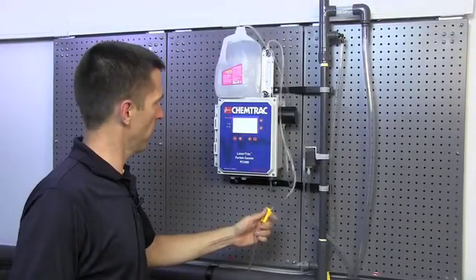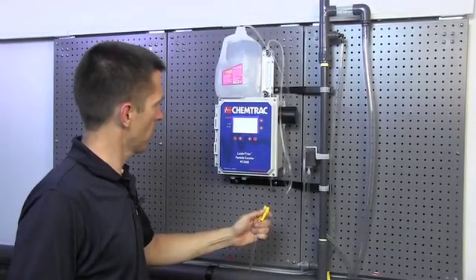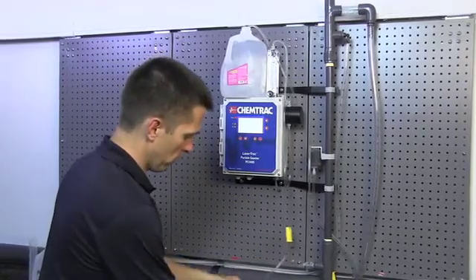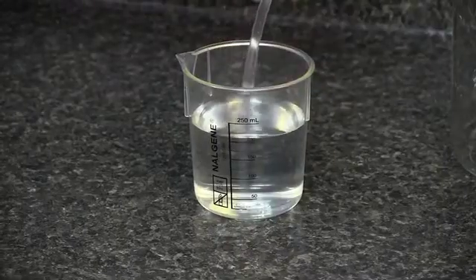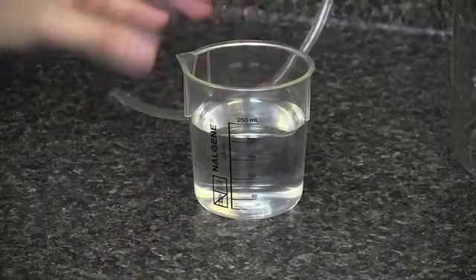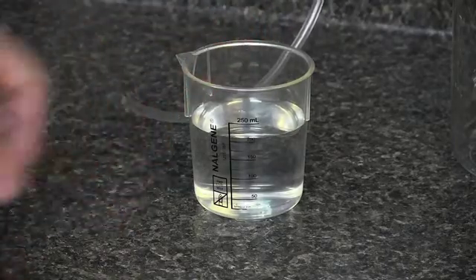Now that we've checked our blank water counts, we're going to stop the flow. And we are ready to see how much volume we used. We can see that we have wasted approximately 200 mils. We don't have to be real exact, but 200 mils is what we're going to use here.